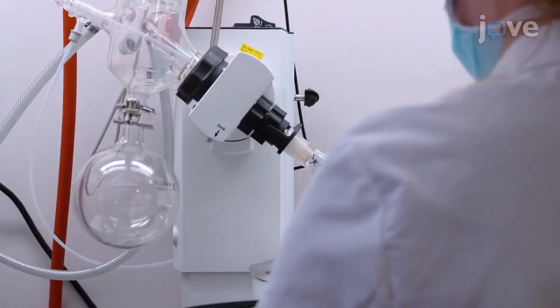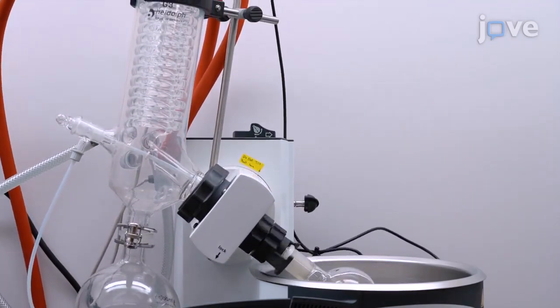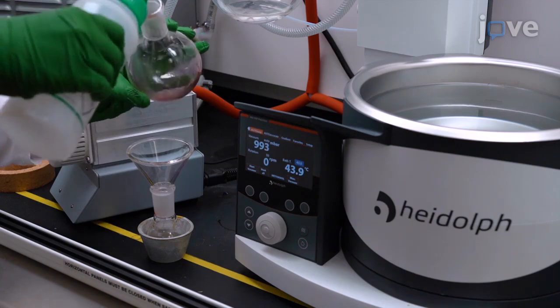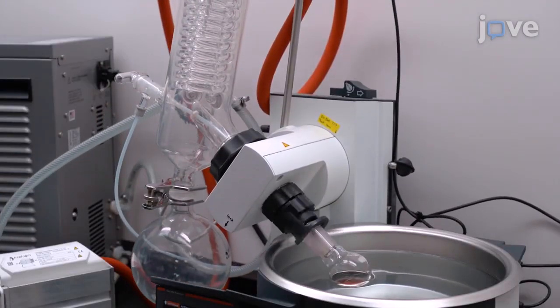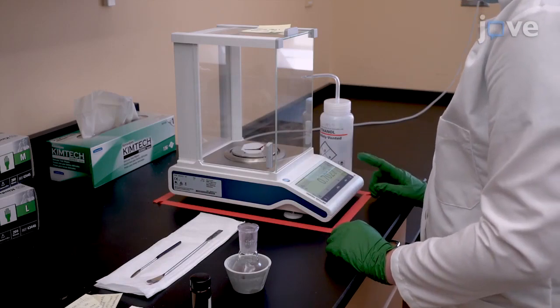Dry the plant extract with a rotary evaporator until it is thickened but pourable in a 300 ml round bottom flask. Pour the sample into a 50 ml flask and rinse the large flask with a small amount of methanol, then continue to dry the sample in the small flask until the methanol is completely evaporated. When finished, weigh the sample residue with an analytical balance and record the mass.